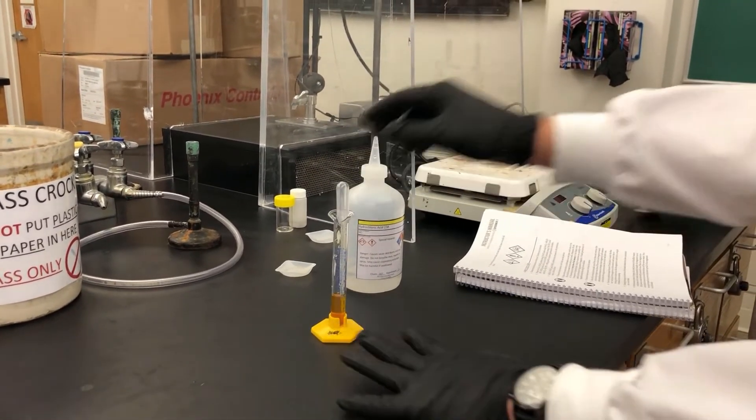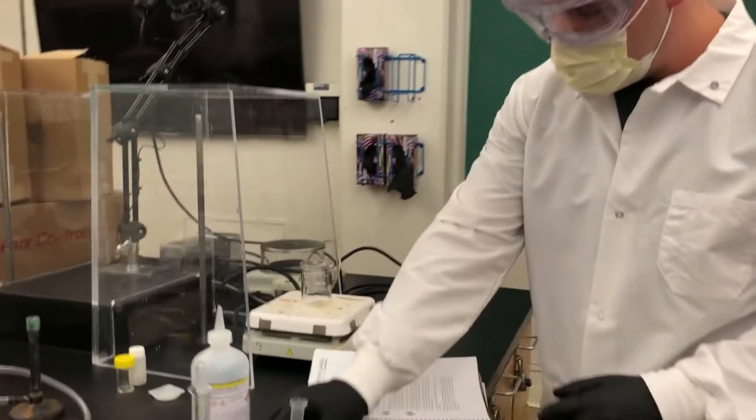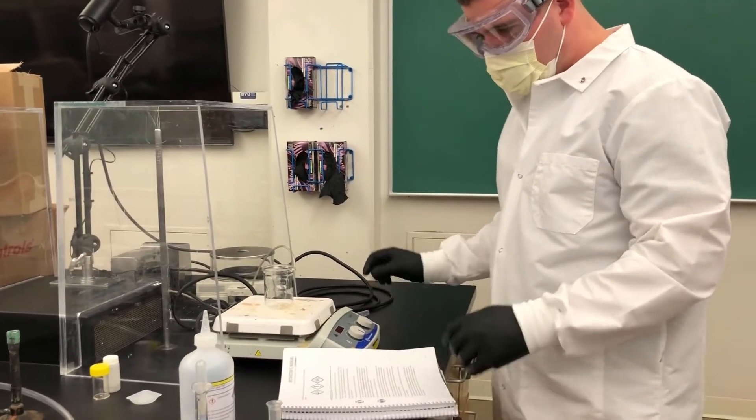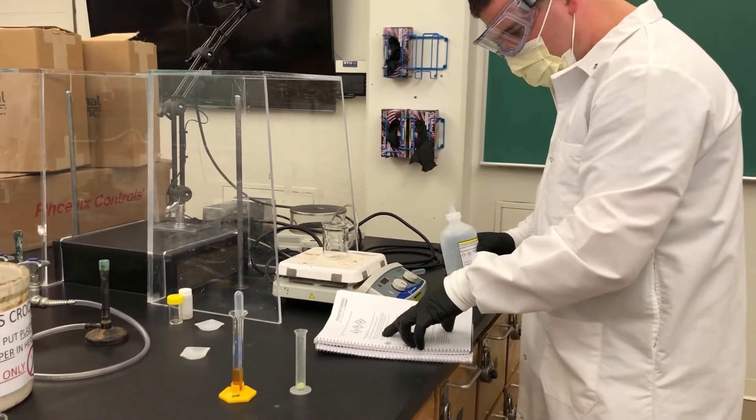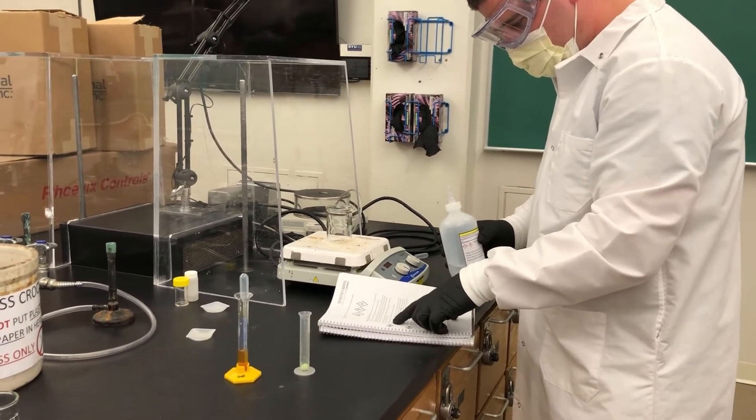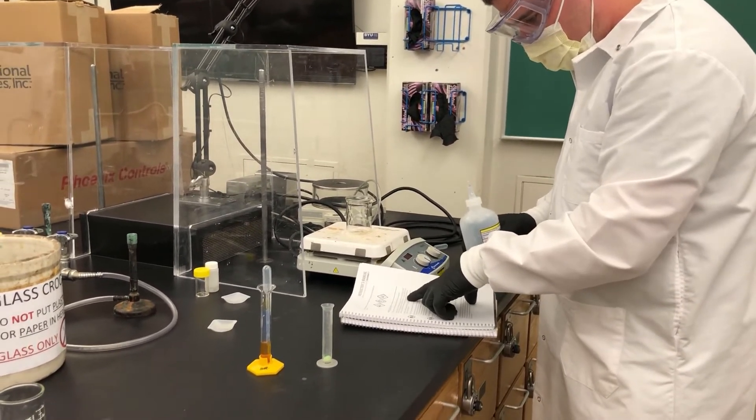Okay. Ben will do the same thing with the iron 2 chloride. For this one, he'll need 1 milliliter.